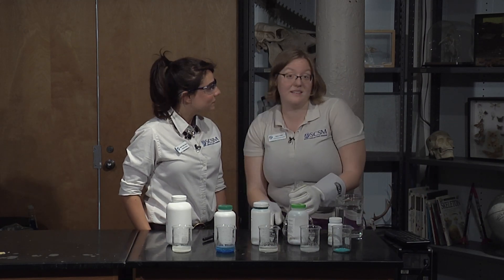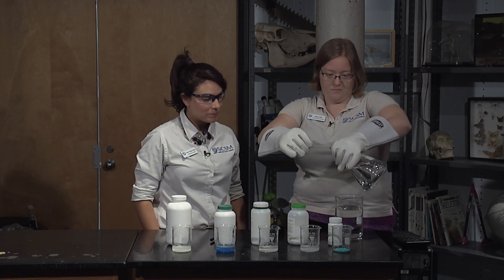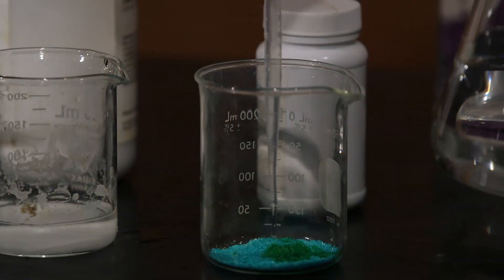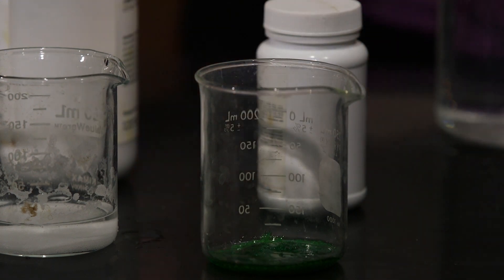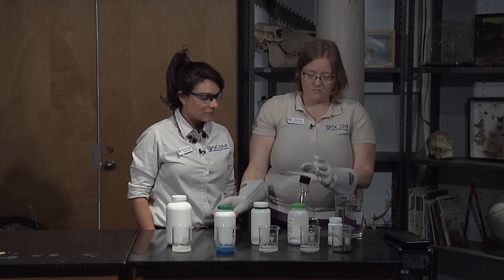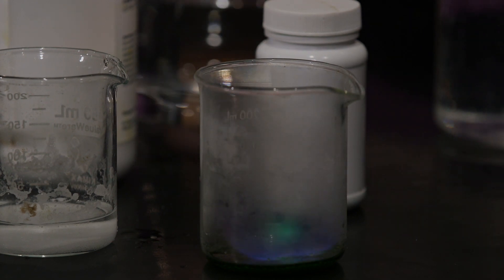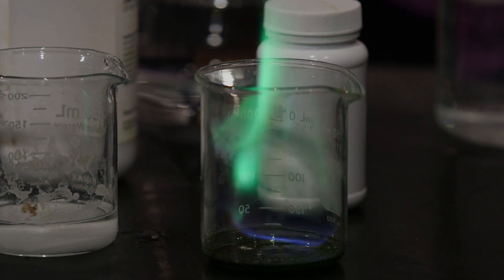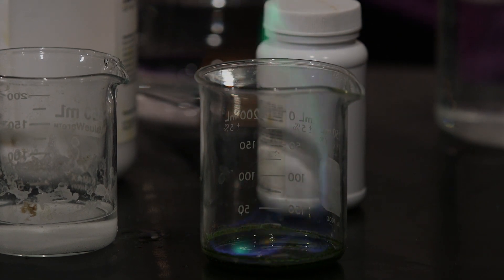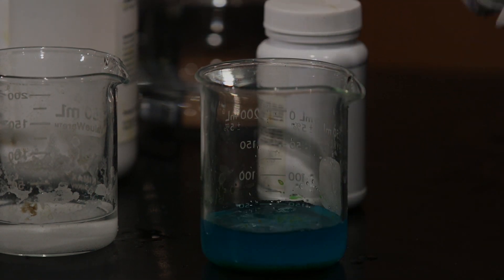And then the last one. This is my favorite. We're gonna do the cupric chloride. And the salt looks green. So it's burning blue for a second. But then we get those beautiful teal colors coming out. That's really cool. Oh yeah, you can see and it's sparkling a little bit. Awesome. So we're gonna set that fire out. And so we just excited, there we go. We excited a bunch of electrons and they cooled back down. And that's why we got our different colors. Awesome.